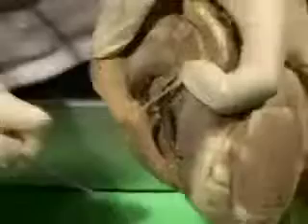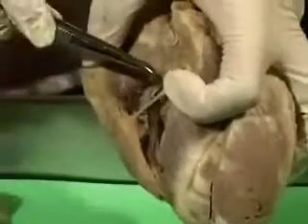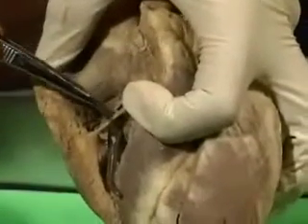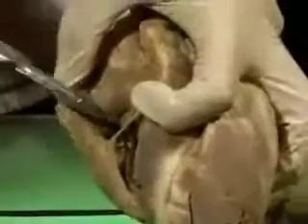Now let's open up the right ventricle, which is here. The first thing we see is this tricuspid opening from the right atrium into the right ventricle. So you can see my probe has come out through there. I'm going to pull it apart, and here you're looking at the cusps. See these cusps here? You all must obviously be wondering what's this thing going right across. This is part of the conducting system which is known as the moderator band. So this is going right across. But let me cut this out so that it doesn't get in the way.